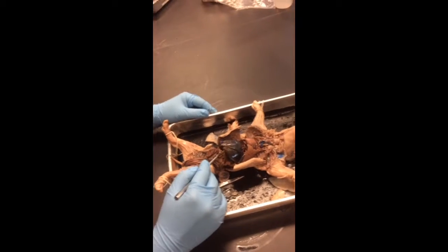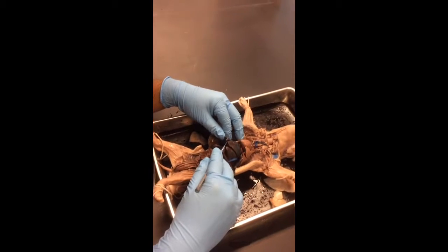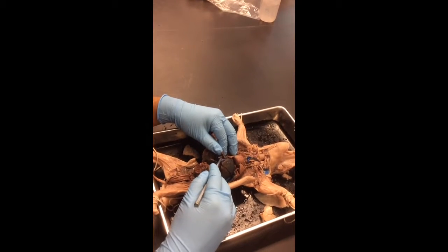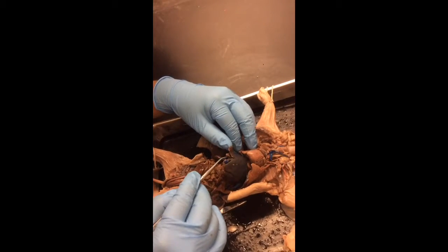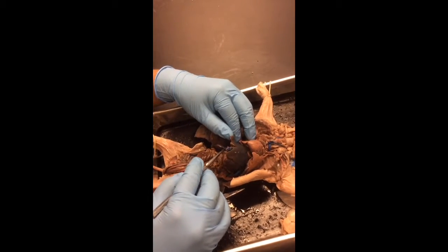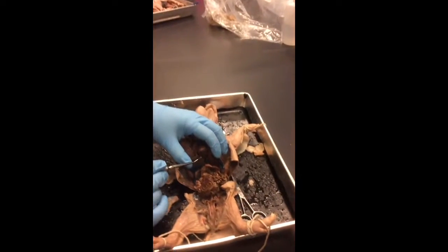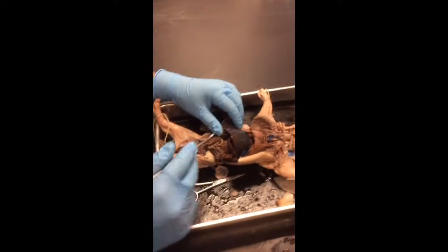Gallbladder. You guys remember where the gallbladder is? It's inside the liver. Yeah. It's this kind of brownish thing inside the liver here. I'll pull it out so you guys can see it. It'll be pinned on your pig, but it's this brown thing underneath the liver. So if you see something pinned underneath the liver, it's the gallbladder, okay? What does that do? Aid in digestion? It holds bile, it stores bile.